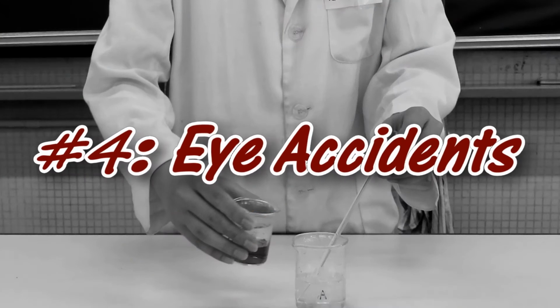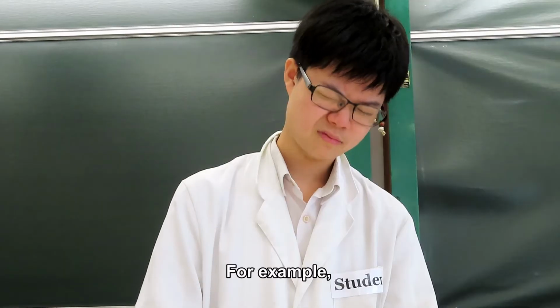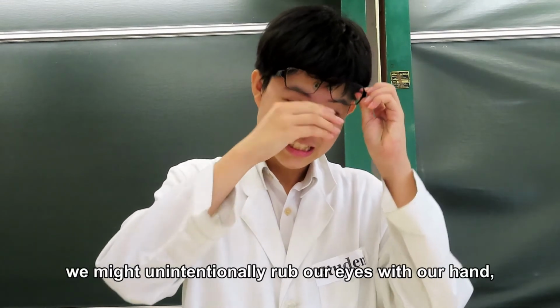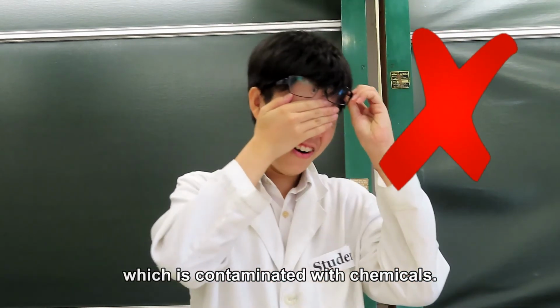Eye accidents. Chemicals might accidentally get into our eyes. For example, we might unintentionally rub our eyes with our hand, which is contaminated with chemicals.